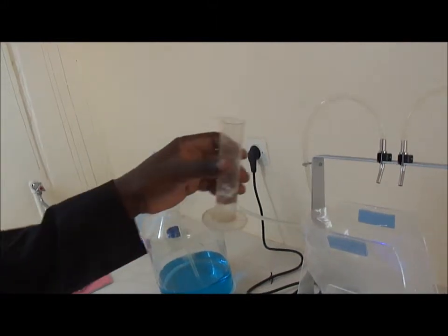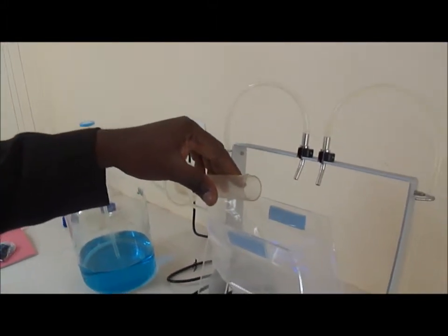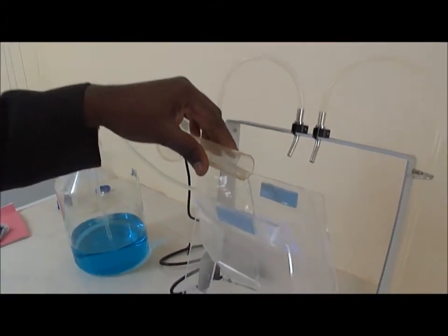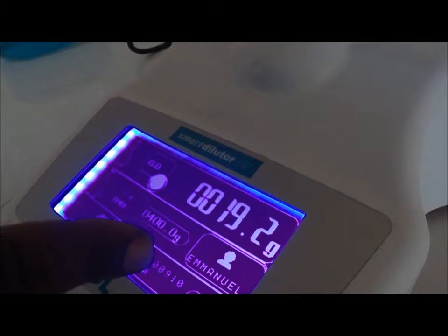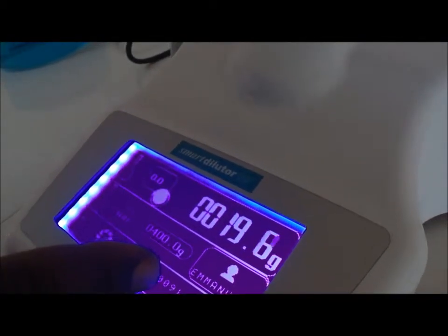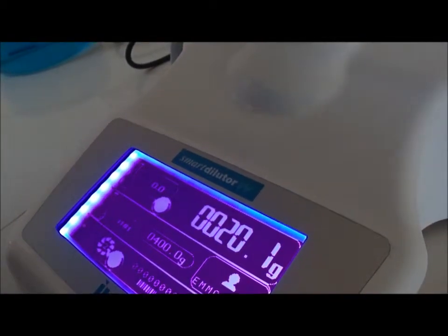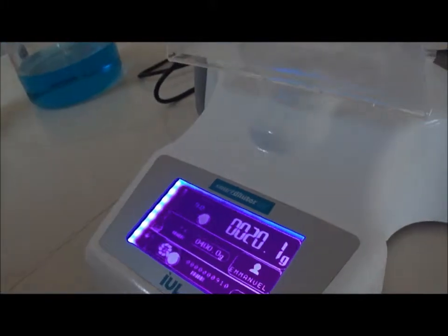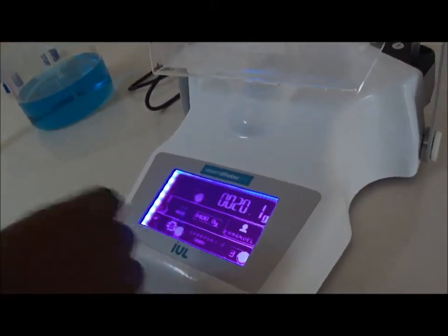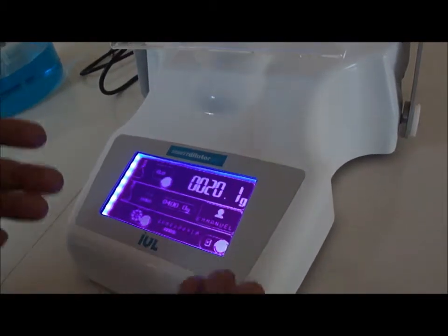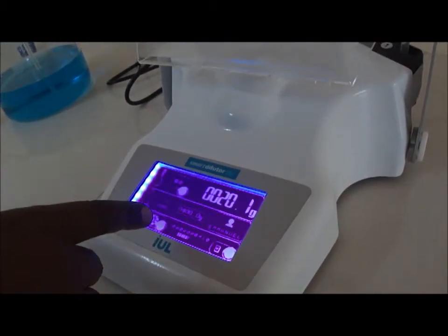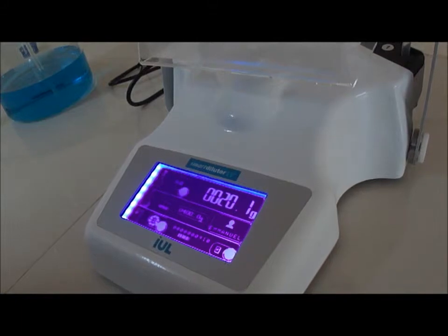It could be a solid. Then you weigh it and you introduce in your container and you see the weight changing here. And I will take something around 20 grams. The targeted weight for dispensing that I have introduced in the parameters is 400 grams.